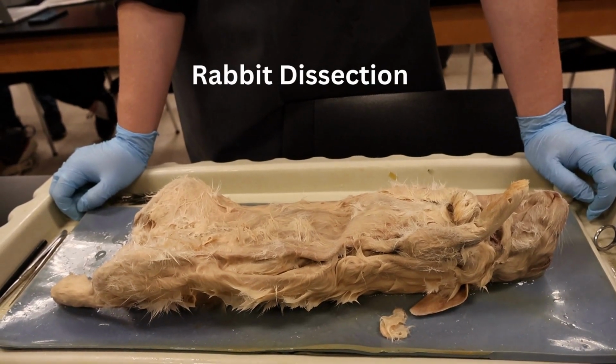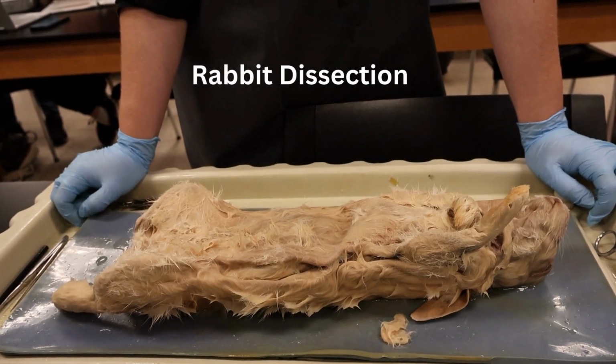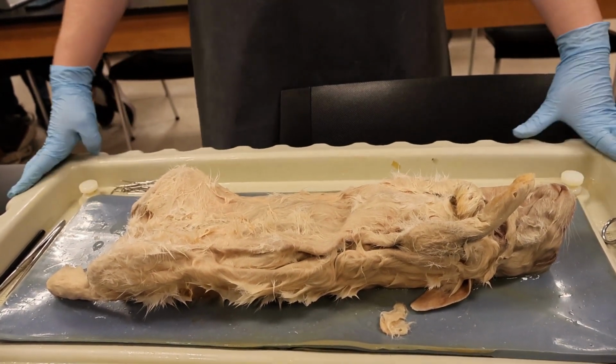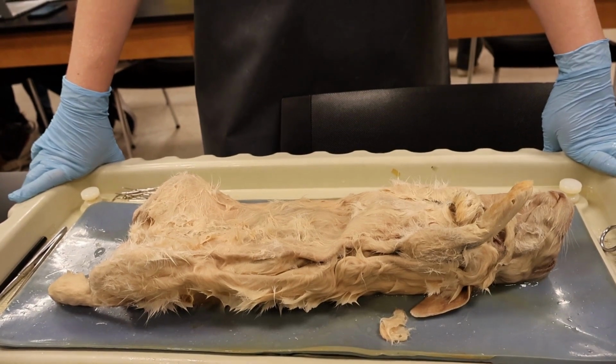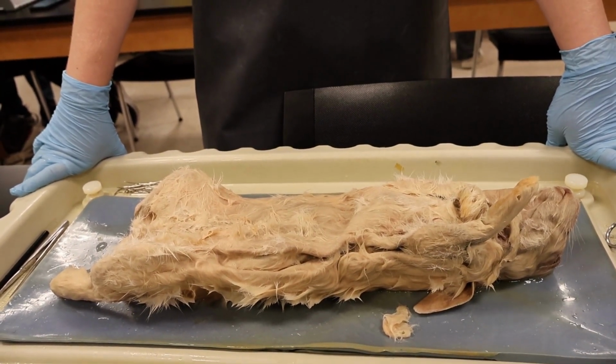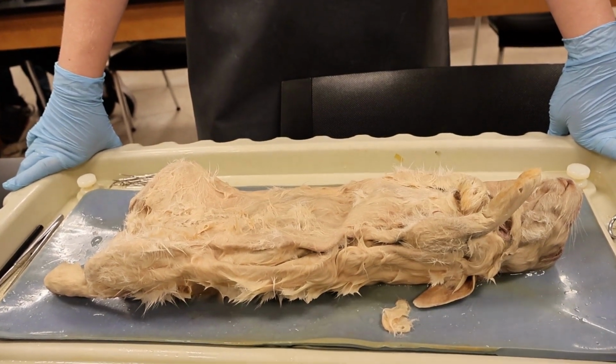Okay, so this is our animal dissection of a rabbit. This is our 1407 Biology for Science Majors 2 class with Professor Scher. Our team members are AlikBrisby, Shardae Sneed, Emily Corville. Okay, so this is our dissection of a rabbit.